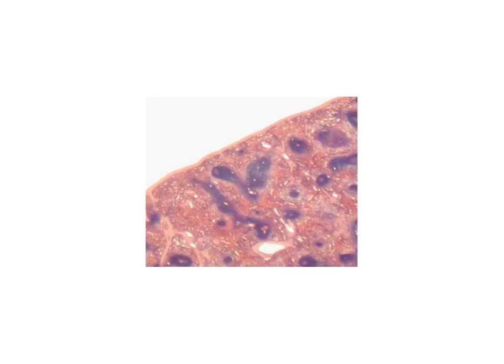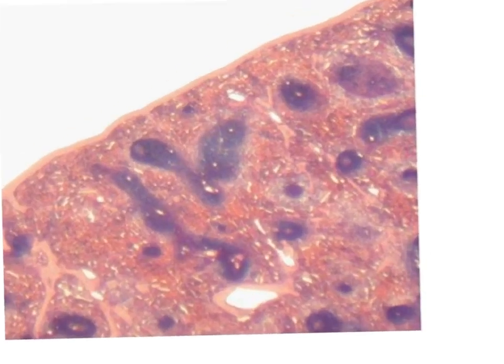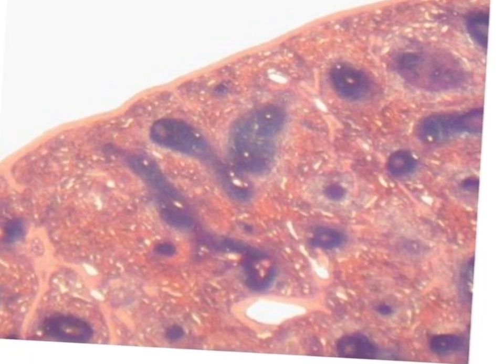Here we have follicles, but these follicles are scattered throughout the section. All of the section is formed of these blue follicles. And if you look carefully in each follicle, you will diagnose this blood vessel, which is called the follicular arteriole. And in between these blue follicles, we have the red area representing the red pulp of the spleen.